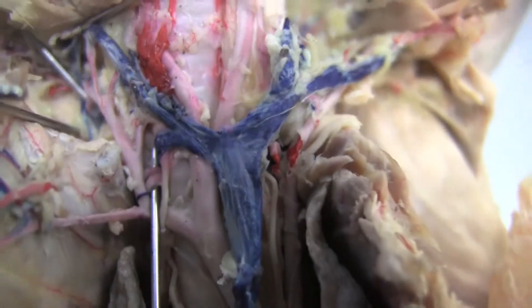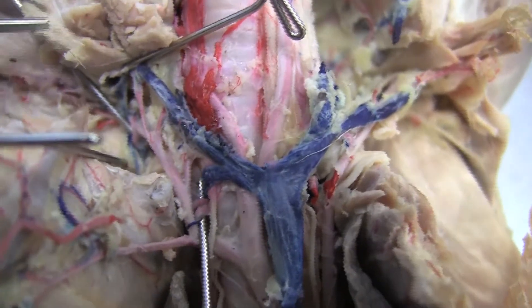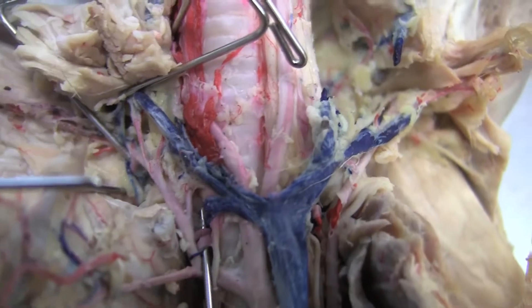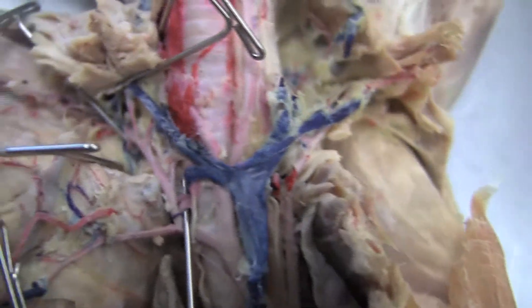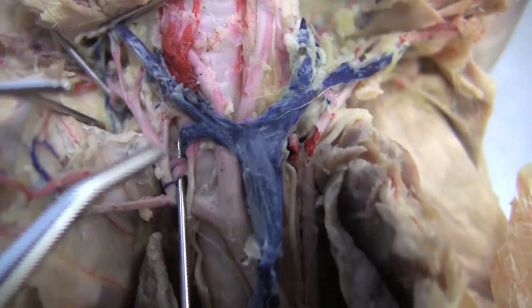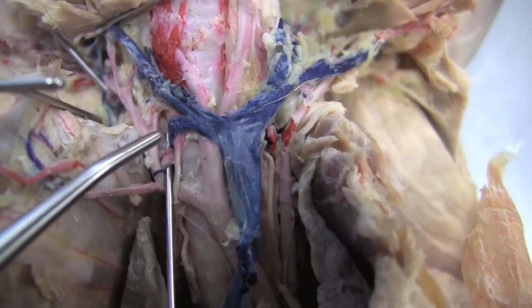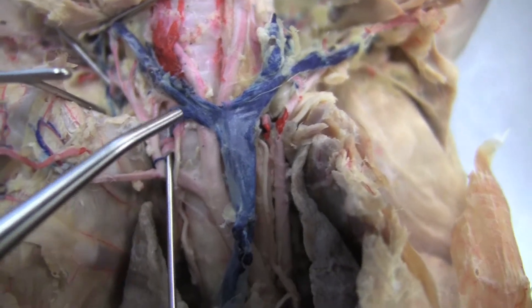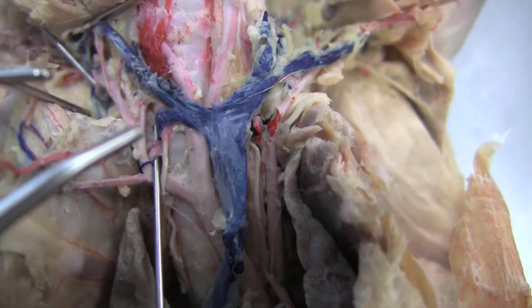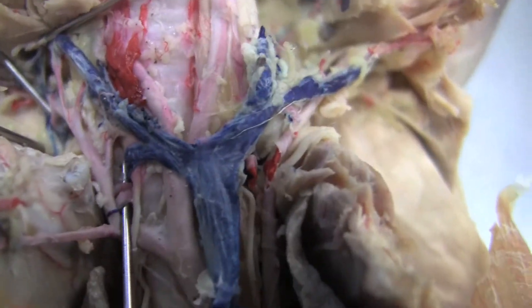Going distally, you will have the thyrocervical as the next one. It should be going up, almost parallel with the carotids, right here — thyrocervical.